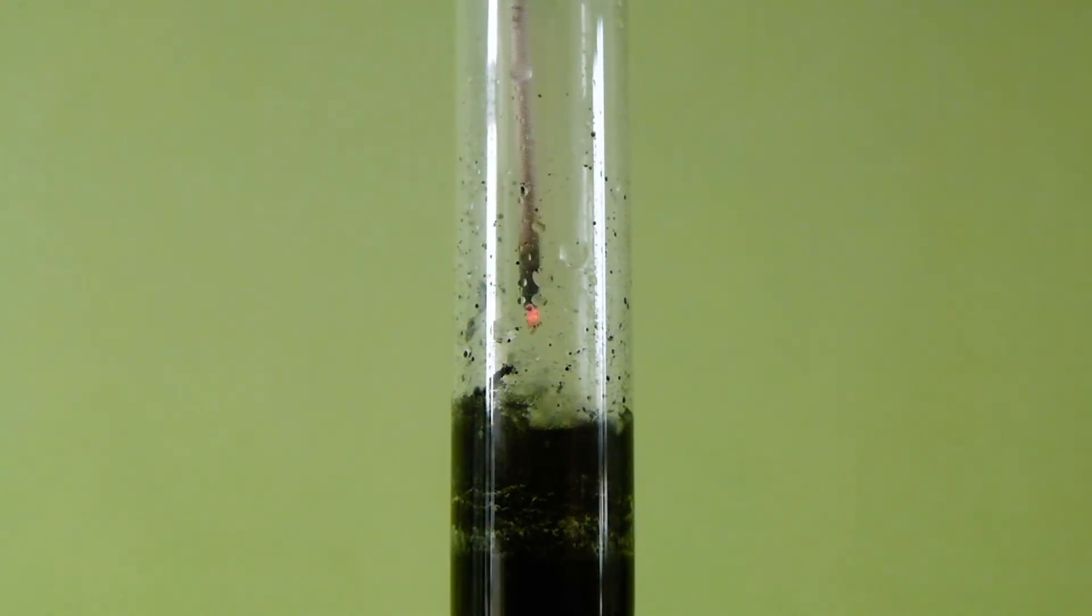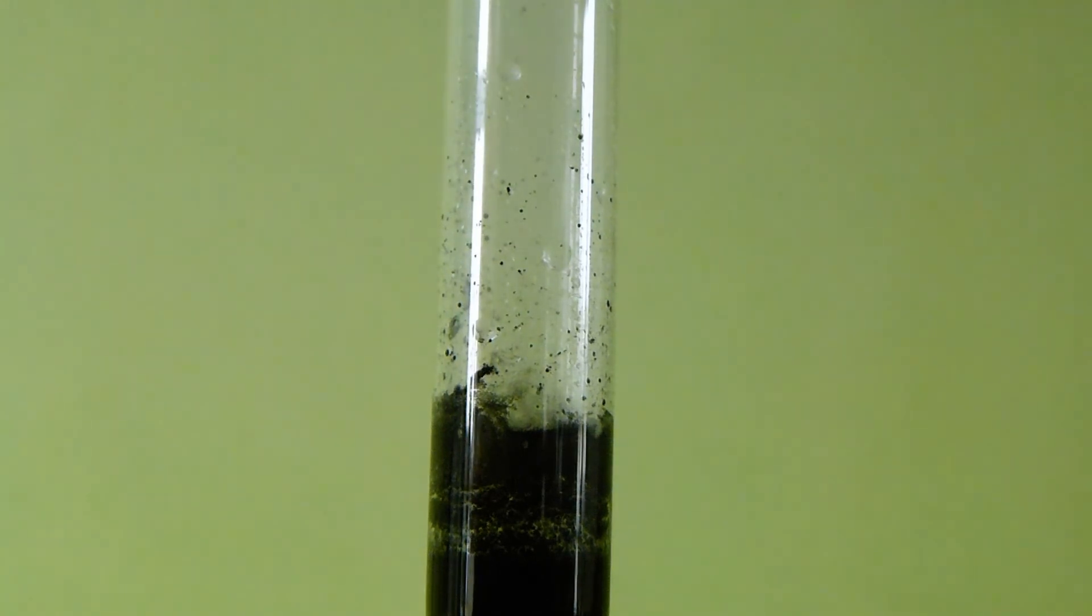Although, the percentage of peroxide in this solid is not 100% by any means, but more like 80-85% due to decomposition while filtering.